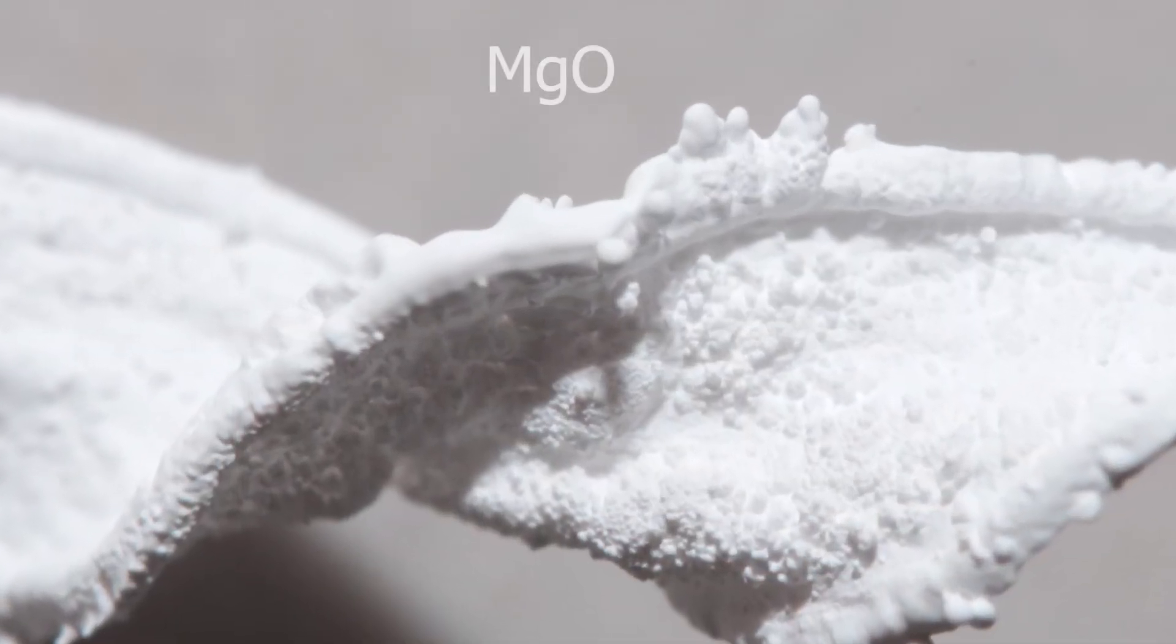Here are macro photos of it. That's what happened to magnesium ribbon when it's burnt.